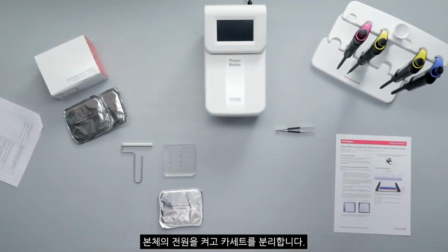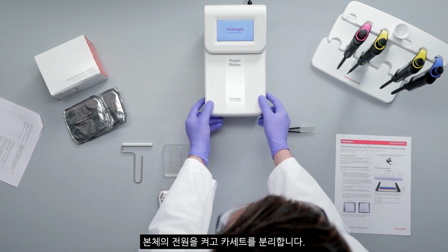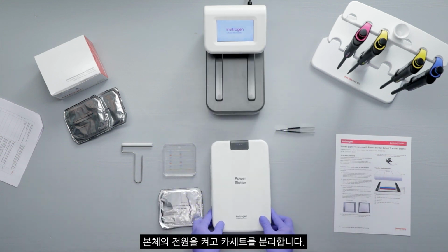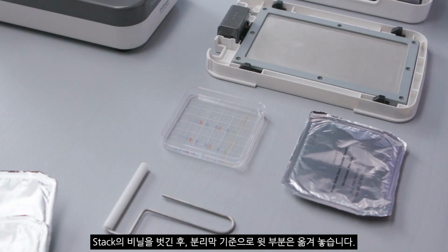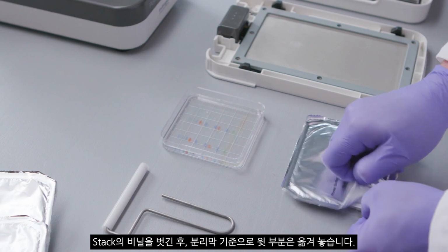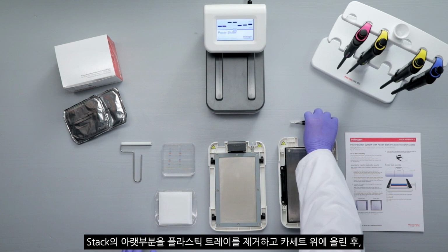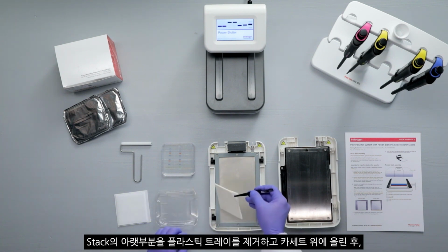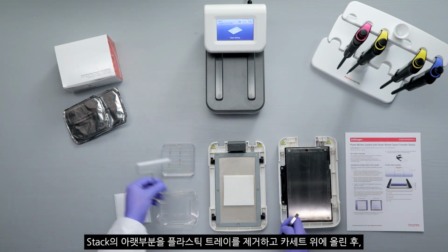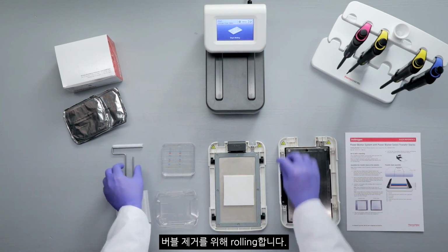To begin the transfer process, flip the power switch at the rear of the device to turn on the system. Open the Power Blotter cassette by pressing the gray button on the lid. Unseal the Select Transfer Stack and separate the top cathode stack. Set the top cathode stack to one side of the bench. Make sure the membrane isn't stuck to the bottom of the separator. Remove the bottom anode stack from the tray using forceps and place the bottom stack in the center of the anode. Use a roller to remove any air bubbles from between the membrane and the transfer stack.